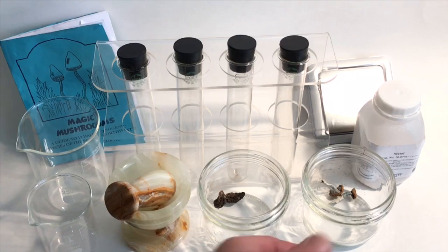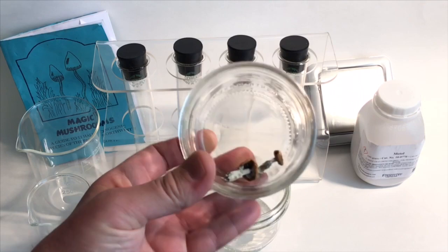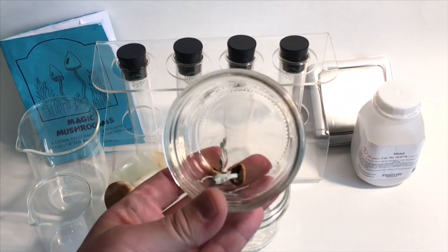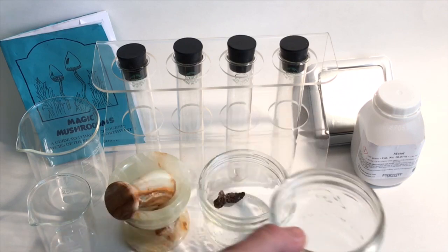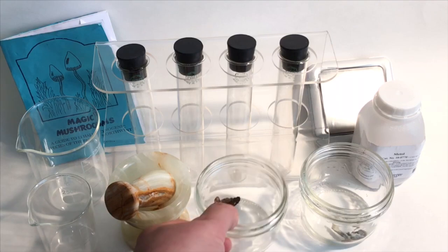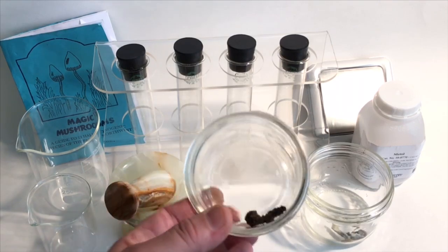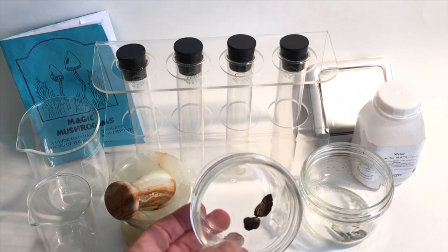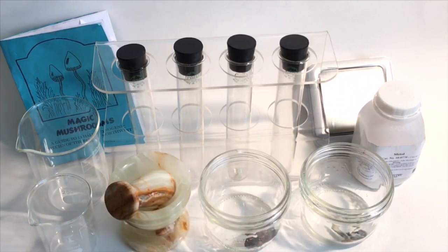So basically what I'm going to do here is I have a couple little tiny mushrooms that I found in the neighbor's grass. And when I found them, I thought to myself, I really think that these are psilocybin mushrooms and that they might contain psilocybin. And these are a couple dried morel mushrooms that I got from the mushroomery. They're at the farmer's market every Wednesday at the People's Co-op in Portland.